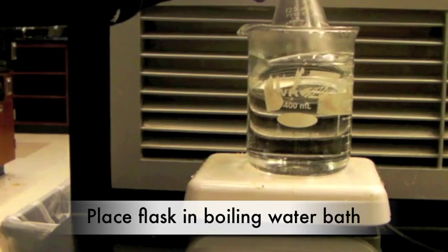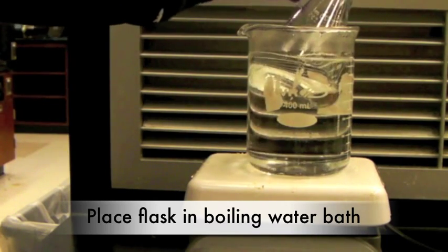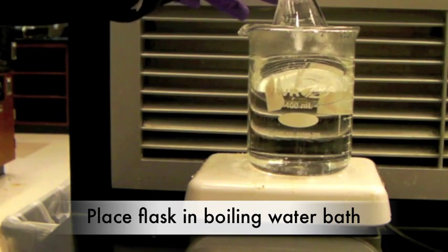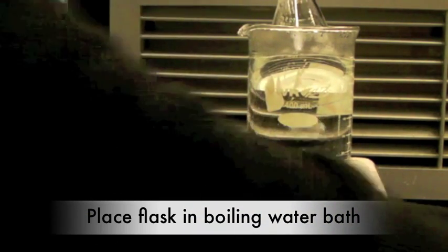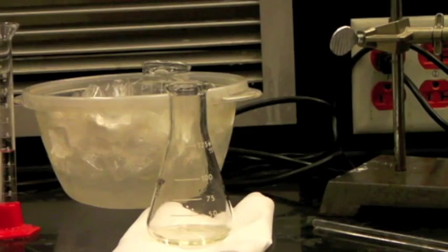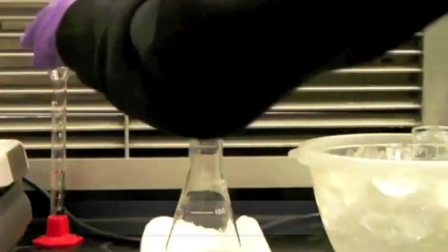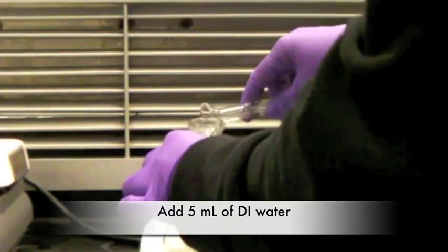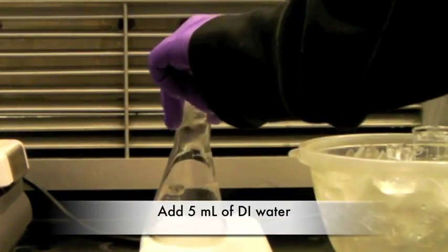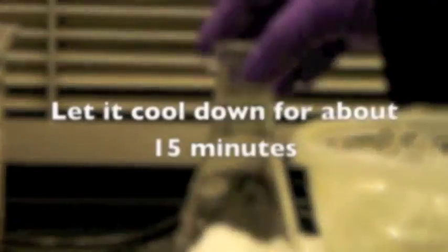Place the flask in a boiling water bath for 5 minutes. Make sure to constantly stir the mixture. Remove the flask from the water bath and add 5 ml of DI water, while holding the flask by the downdraft hood at your bench. Continue to stir until the contents are cool at room temperature. This takes about 15 minutes.